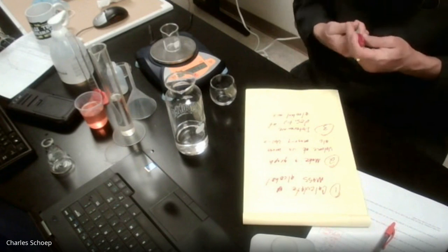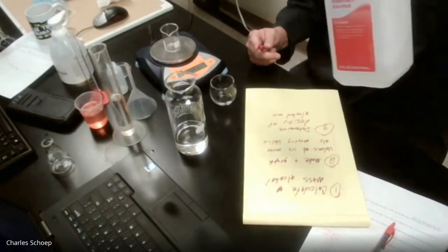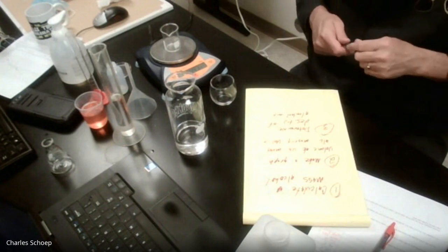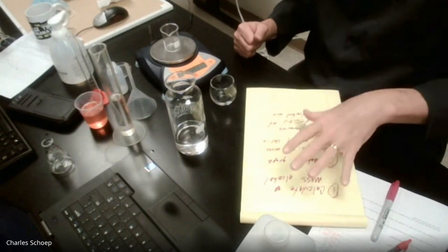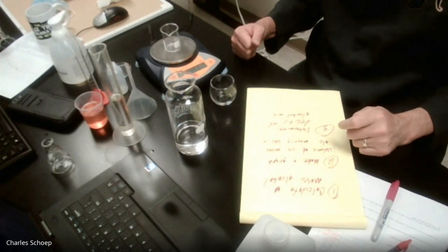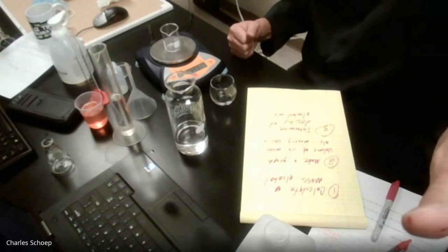It's actually an alcohol water mix, but determine the density of the liquid inside of there. And even if you don't know how to do all of this, you should be able to do some of this. And so we'll come back together in 15, 20 minutes, and we will debrief this. And I will be on the call if you have any questions.